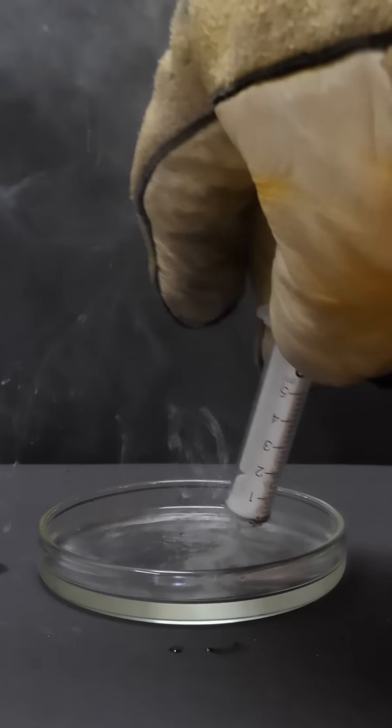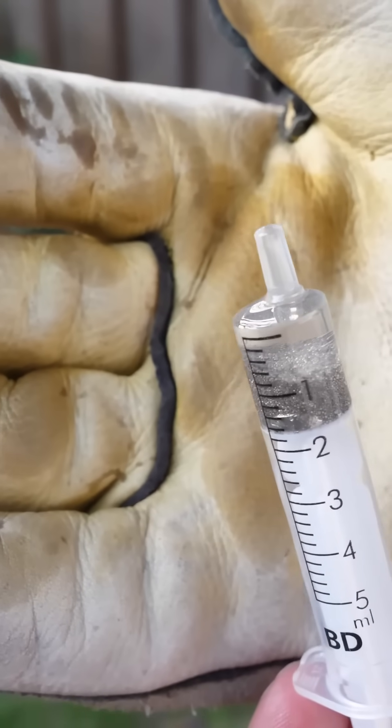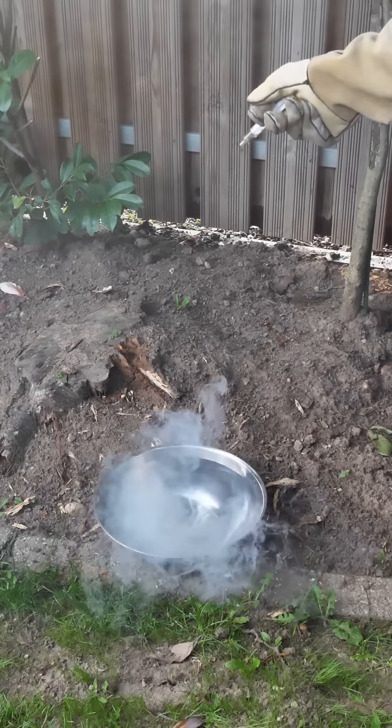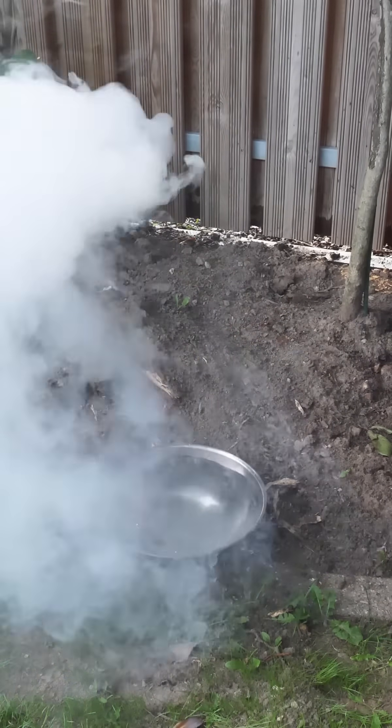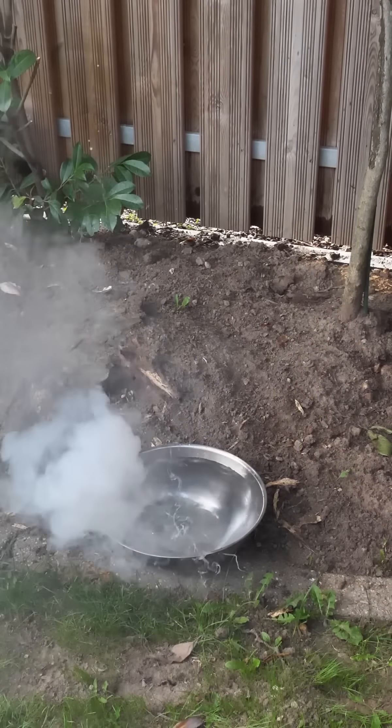The cesium explodes in such tiny quantities, producing an extremely loud, sharp bang. And that was maybe a total of one and a half grams.